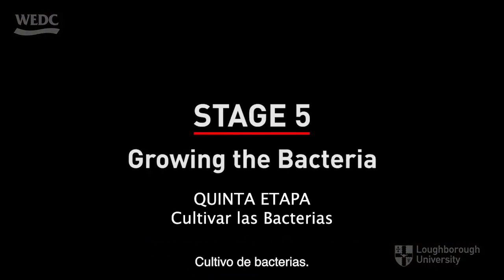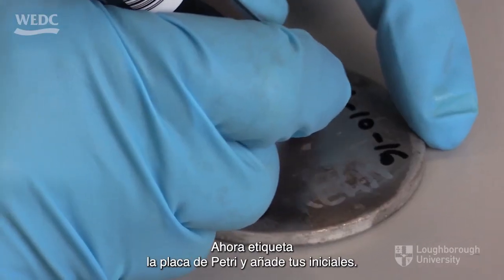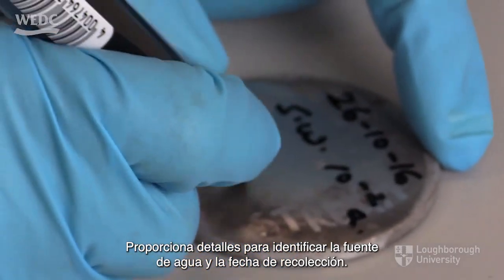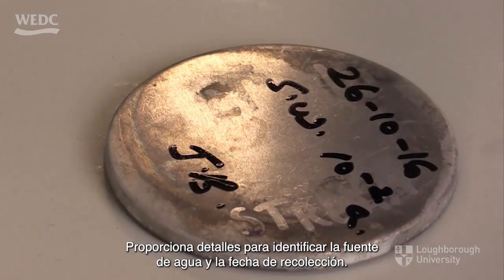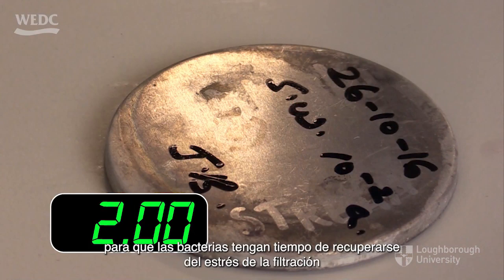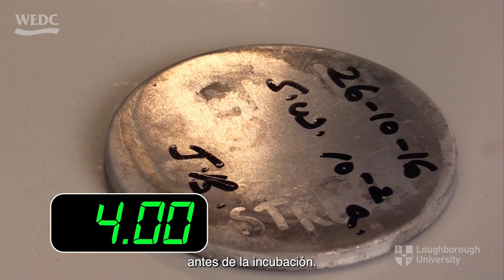Growing the bacteria. Now label the petri dish and add your initials. Provide details to identify the source of water and the date of collection. Then leave it at room temperature for up to 4 hours, so that the bacteria have time to recover from the stress of the filtration process before incubation.